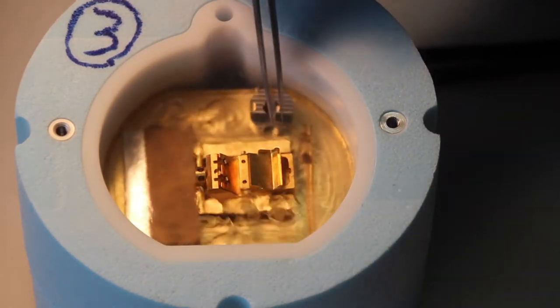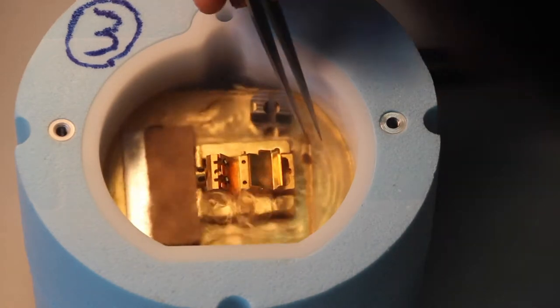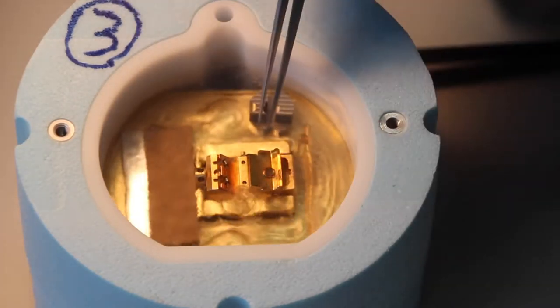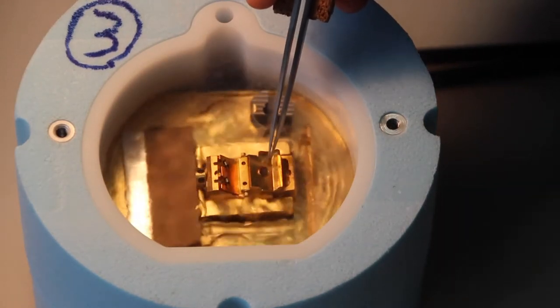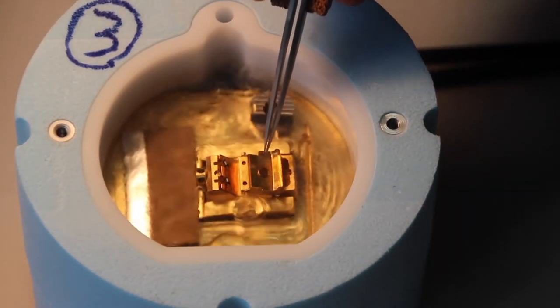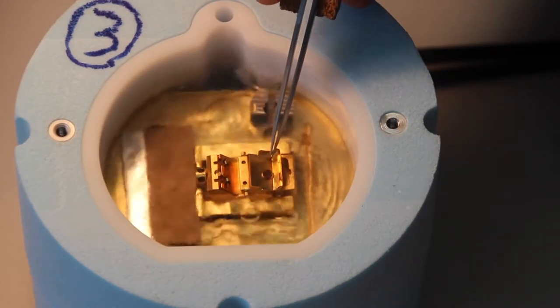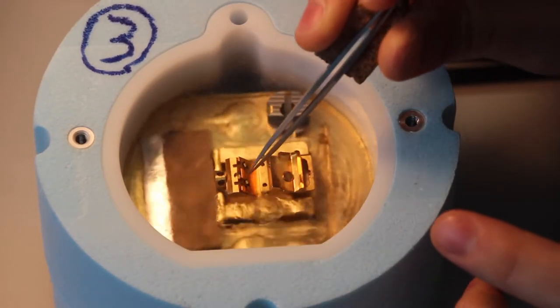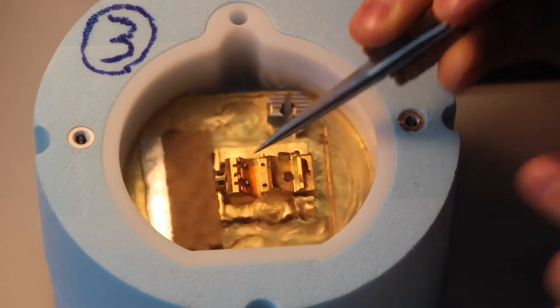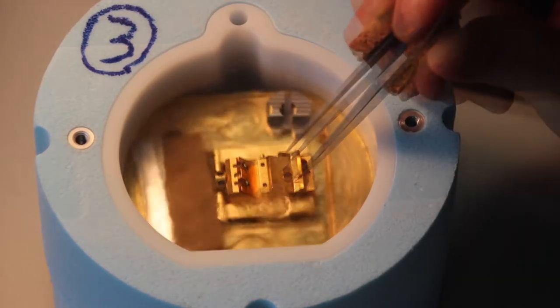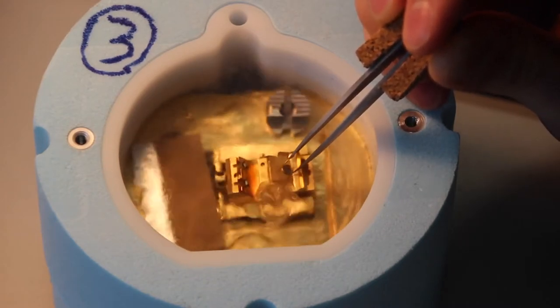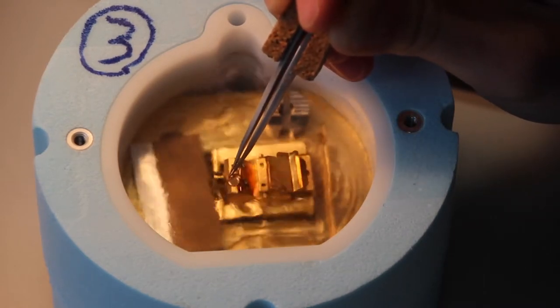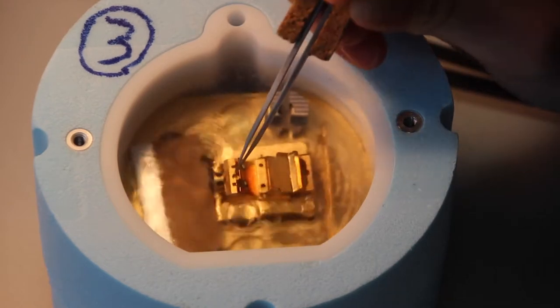Next, with the thick rim of the grid facing me, I'm going to grab my first grid and place it on the shield here. Now this is where you're going to want to make sure that you get its orientation the proper way for your system, because this is now going to be critical that your lamella, or the direction milling, is now parallel with the shuttle. Keep that in mind when loading. I'm going to take the grid now and place it into this clamp here. Sometimes I put it on this top and then slide it in that way.